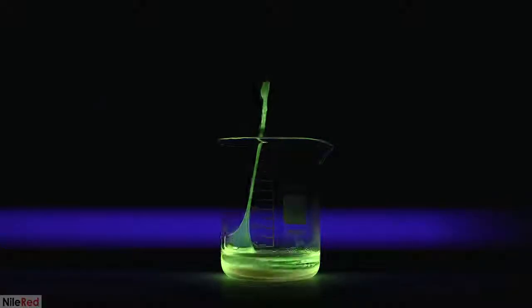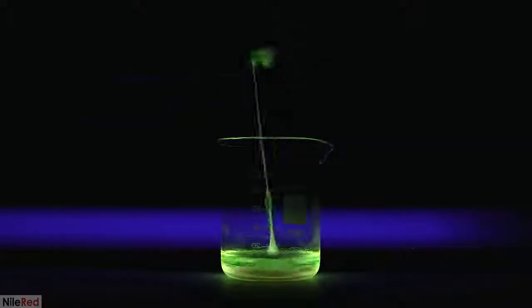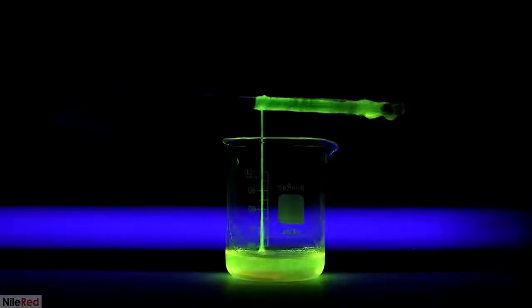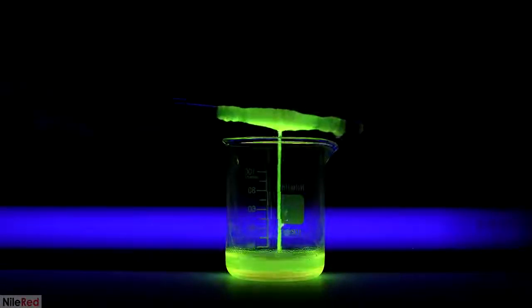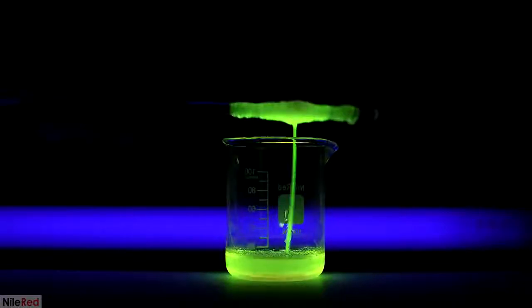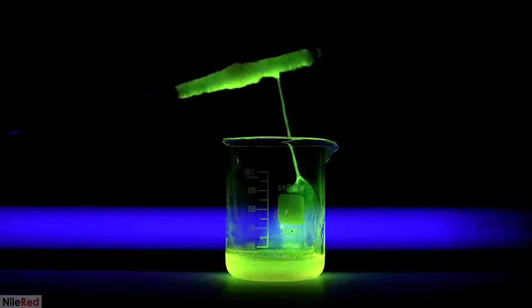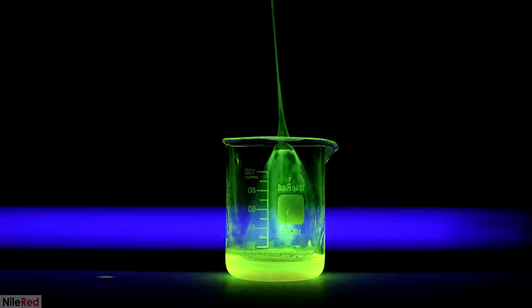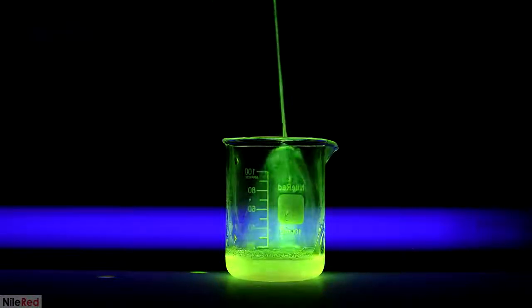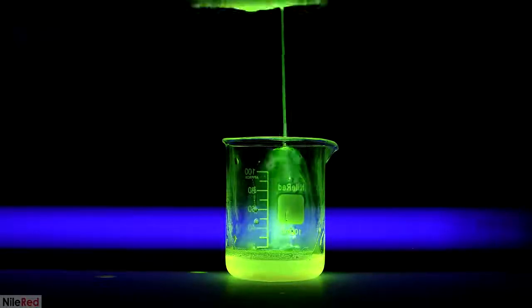Just like before, I use the tweezers to pull out some nylon. What's kind of cool is that we can tell how much water we're pulling up with the nylon based on how bright it fluoresces. At some point, I accidentally got the nylon stuck to the side of the beaker. At first it was a mistake, but it ended up being pretty interesting. In hindsight, I wish I put down the glass rod, and using my fingers, I probably could have pulled off a super thin sheet of nylon.